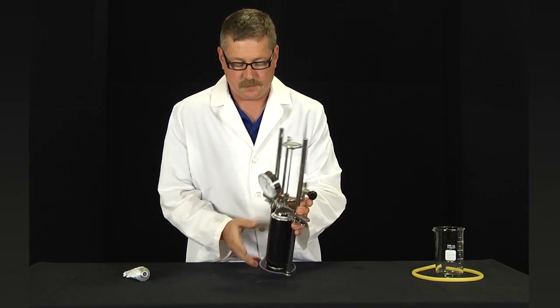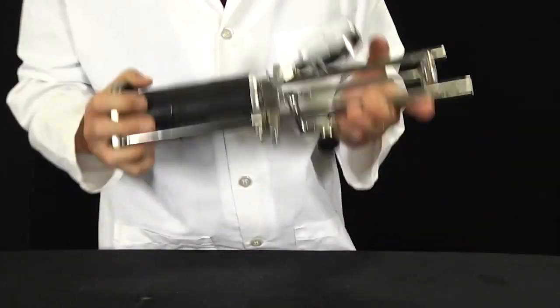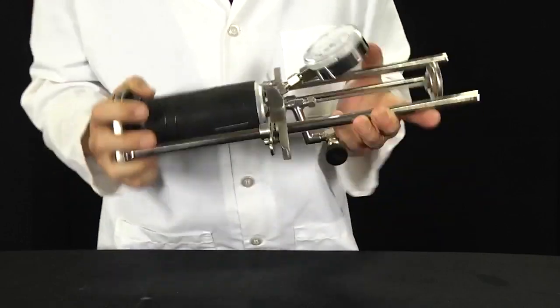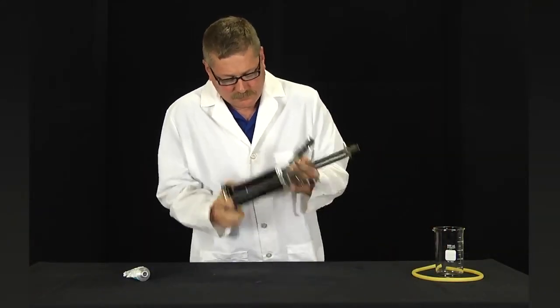Hold the instrument at the bottom of the base with the right hand while the left hand holds both the guide rod and the dial thermometer stop. Shake the instrument with a rapid back and forth motion until maximum gauge pressure has been obtained.